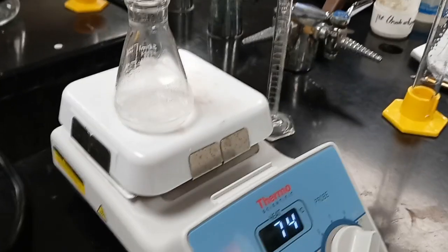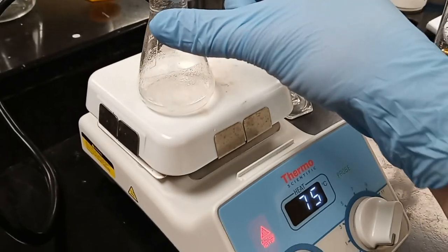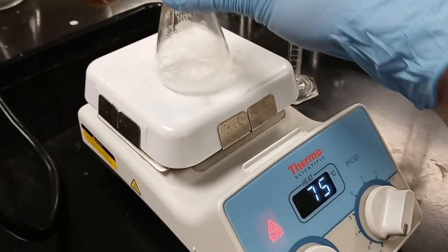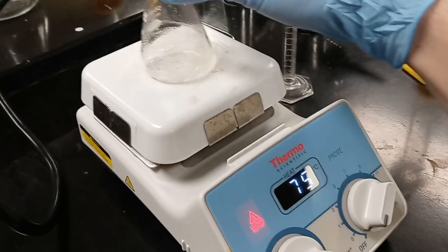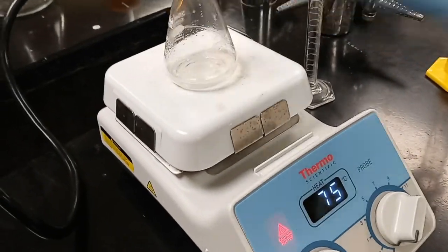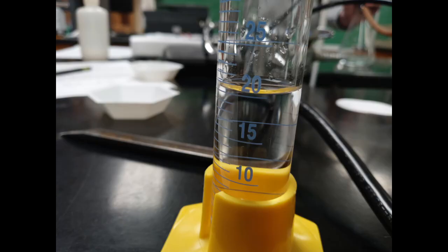The mass of the aspirin synthesized is 1.4467 grams, and there is an expected yield of 2.6018 grams, leading to a percent yield of 55.6%. The low yield is believed to be from some spillage along with doing too many washings.